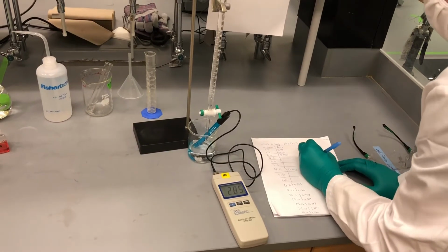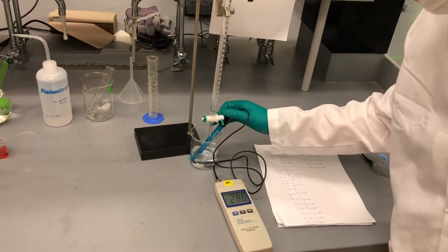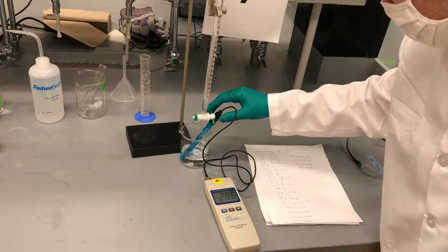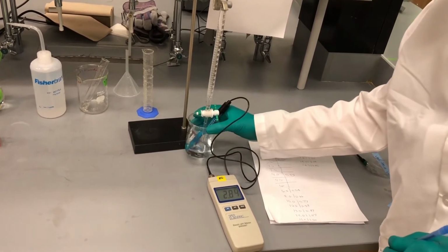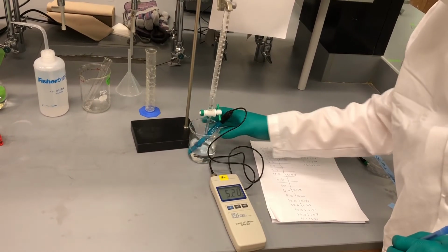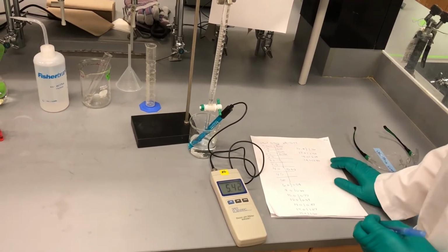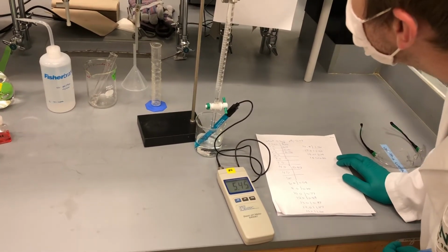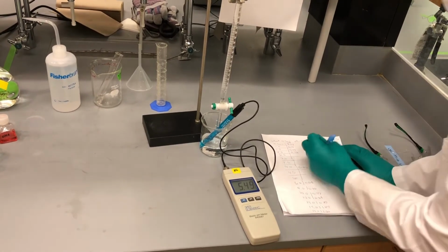18.5. Should I keep going at half a milliliter? Maybe 0.25. See that? Actually, I'm at 18.5 right now. Well, see, yeah, we overshot it a little bit. We added too much. We should have gone adding even 0.3 milliliters. It's going to shake it up a little bit.